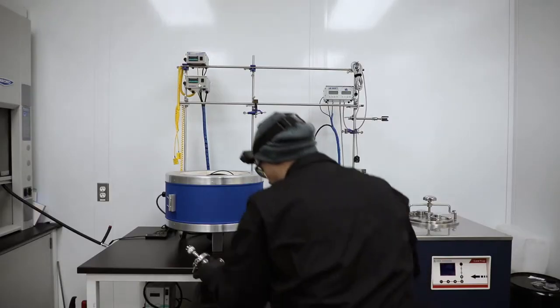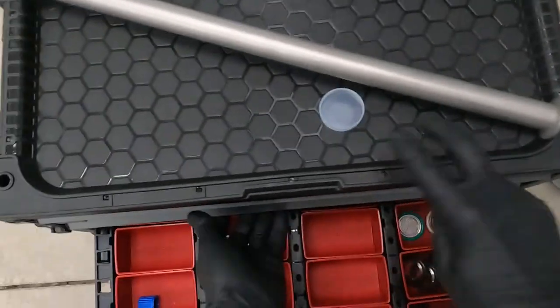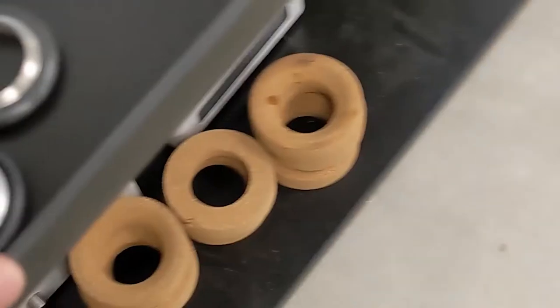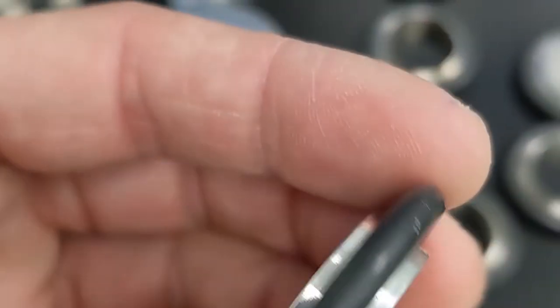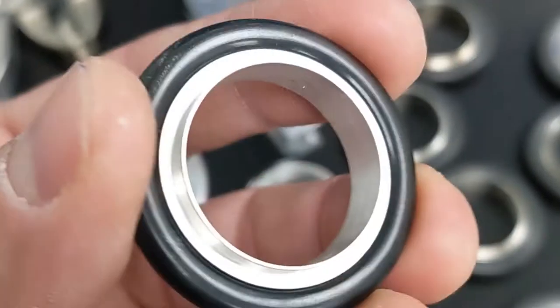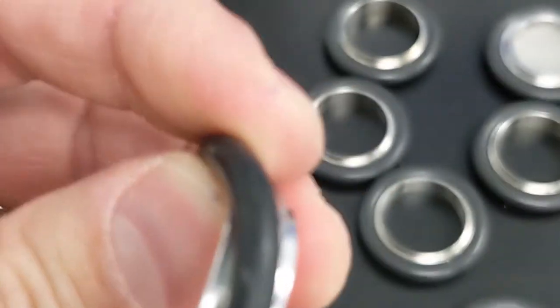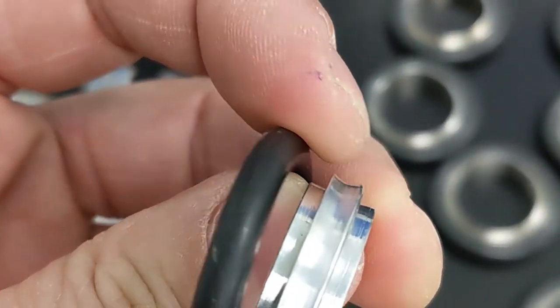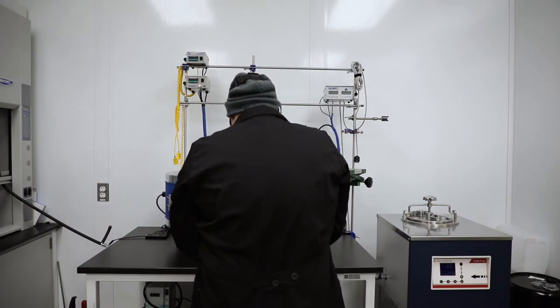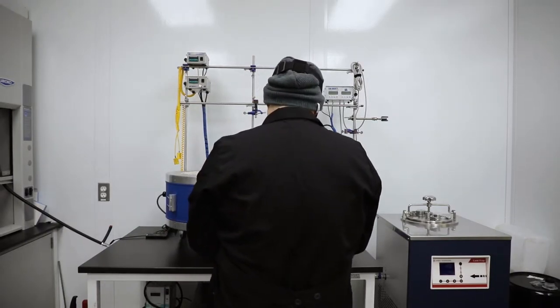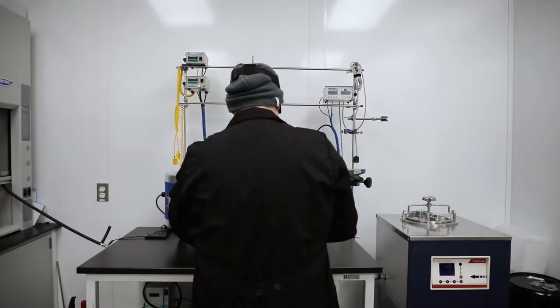So I will assemble this off of the system. These regular O-rings we want to make sure that these are free of debris and not misshapen, dry rotted or anything. All these little parts are integral to the seal of your vacuum system.